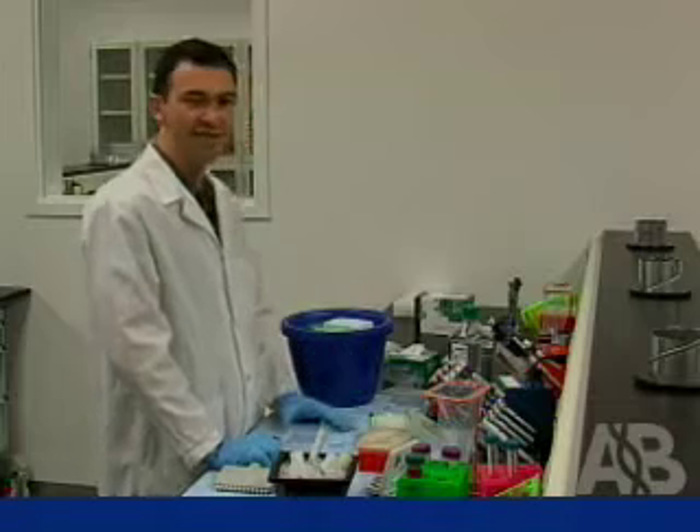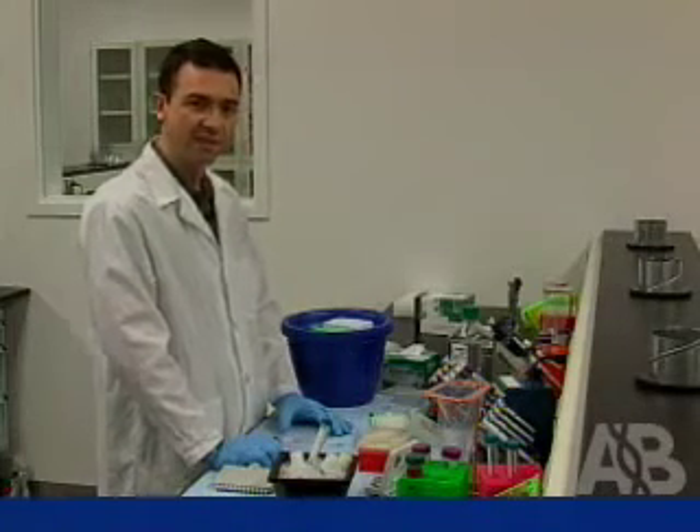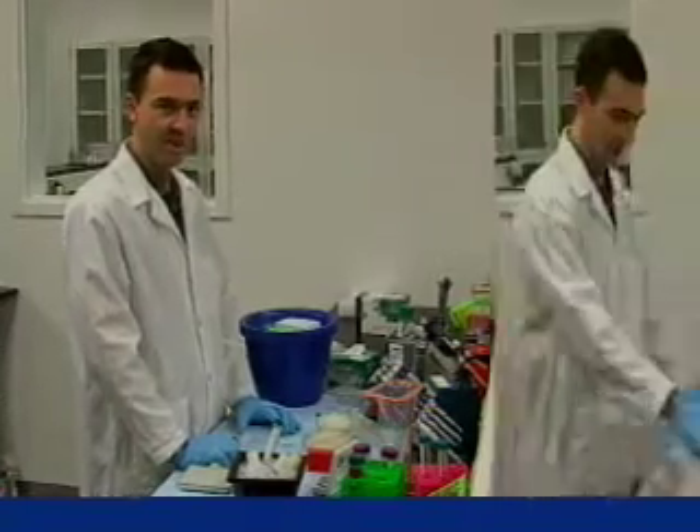What I've got here is the lysis solution with the DNase-1 already added, and cells that have been cultured in a 96-well plate. We've removed the media and washed the cells once with PBS.